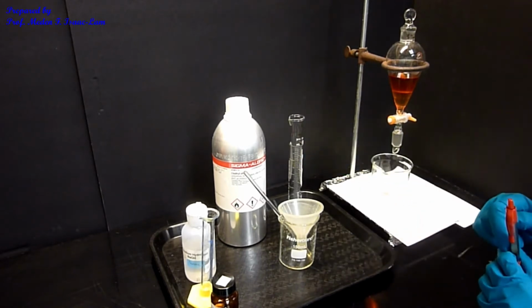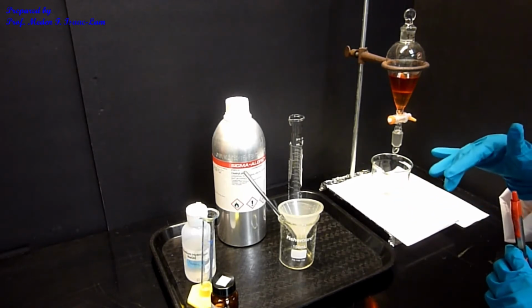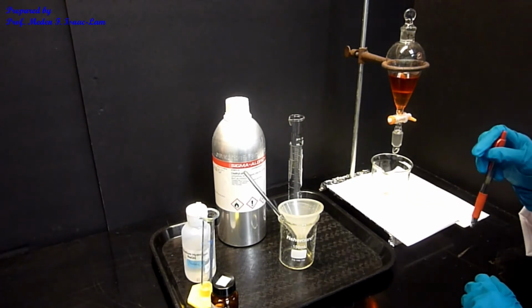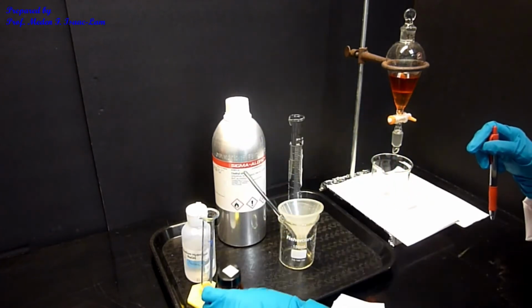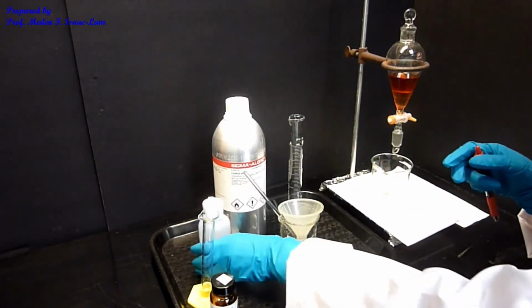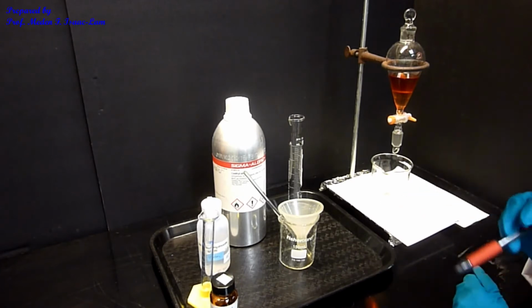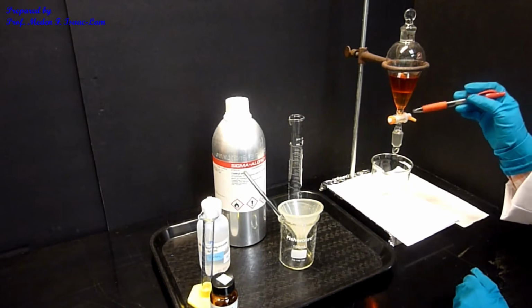So the diethyl ether, when you mix it with the aqueous solution, is going to be the upper layer. That means that in this sep funnel, we now have 5 components: 3 components coming from the mixture, the unknown, and then I added the base, which is sodium hydroxide, and then I added the ether. Diethyl ether is hydrophobic, and it will not mix with the aqueous solution. So now I have 2 layers, an upper layer and a lower layer.